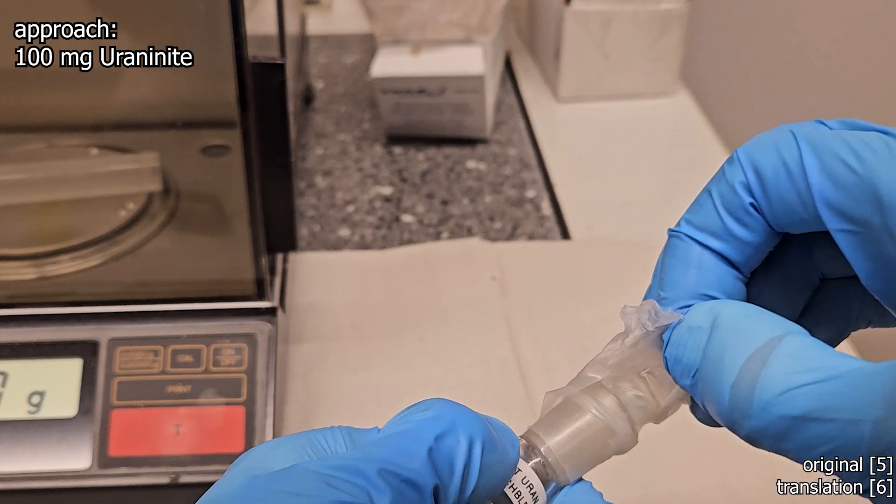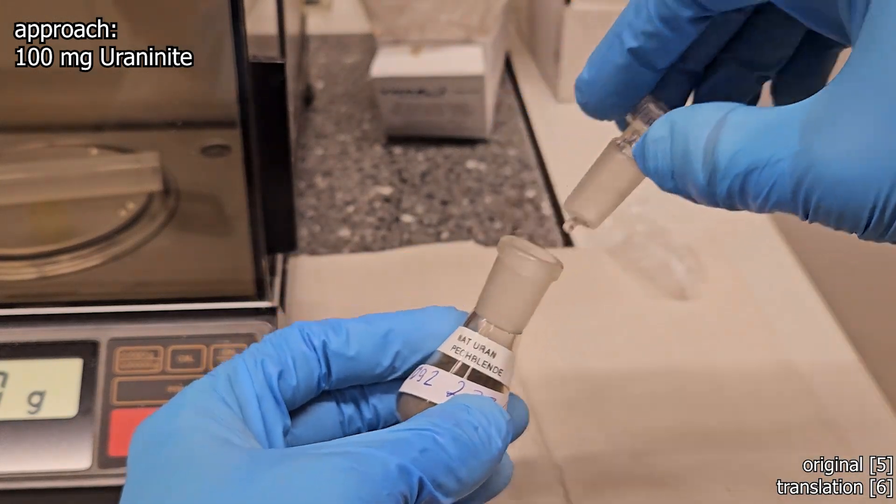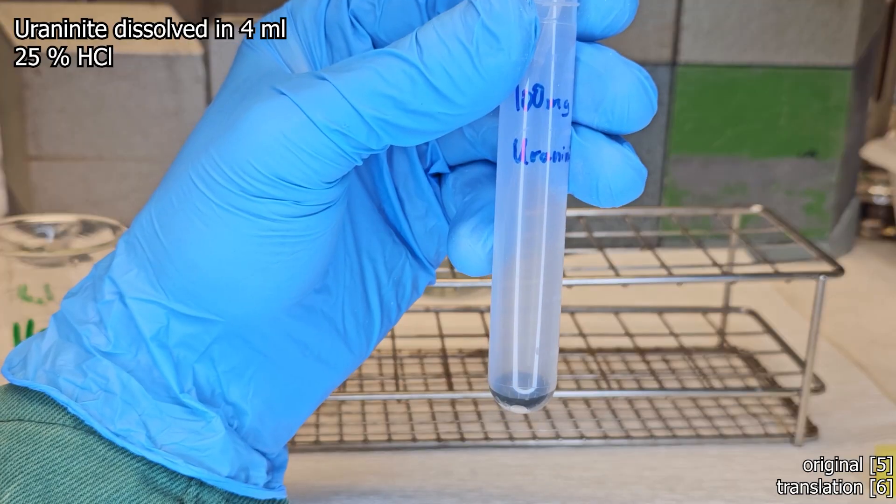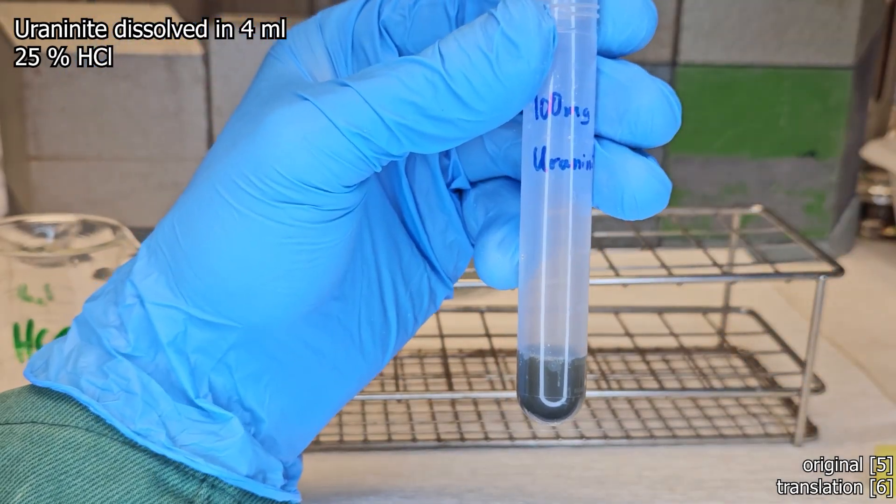We have to tweak the residue, which I will explain in more detail in the video on radium, for the Curie separation process to polonium in order to make the observations that she first made.